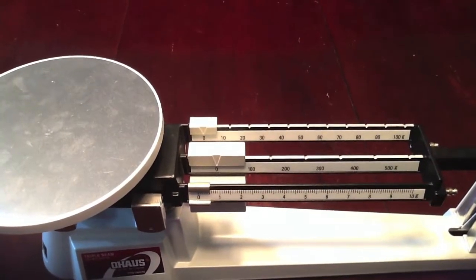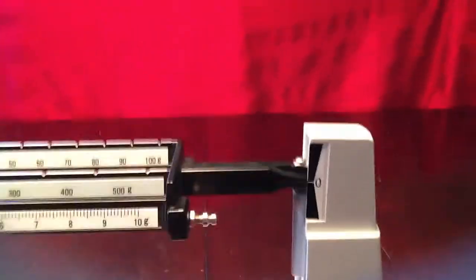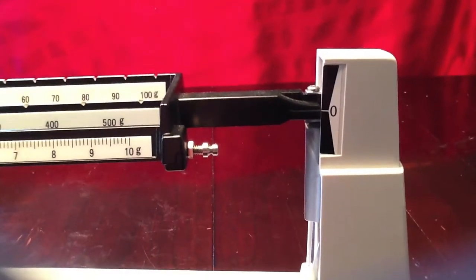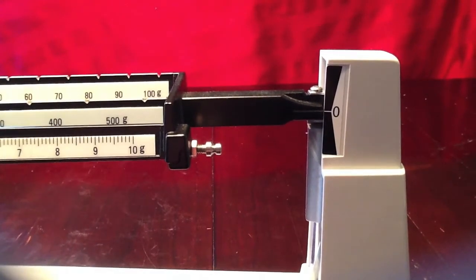Now that we have all of our riders at the zero mark and our arrow is at zero, we will proceed to begin to measure our first object.